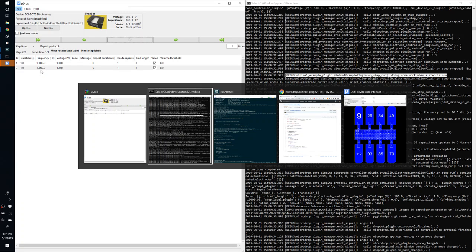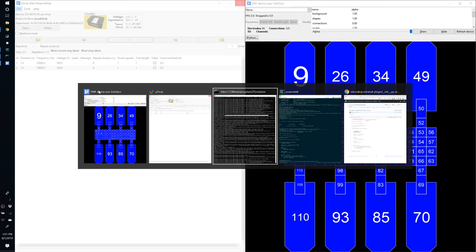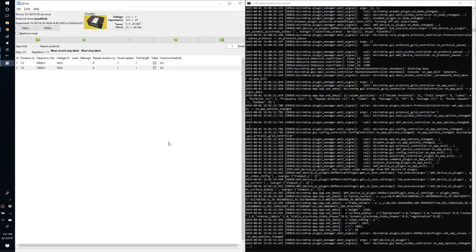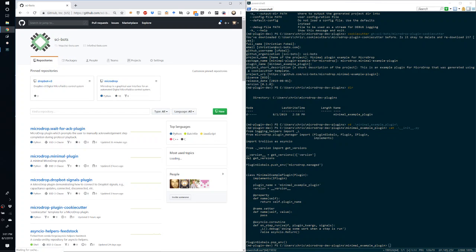Now, quit Microdrop. Okay, so in this example, we've demonstrated how we can create a new plugin, how we can update the Microdrop environment variable, Microdrop_plugins_path, for Microdrop to discover our development plugins, and how to use the cookie cutter template to help us create new plugins.